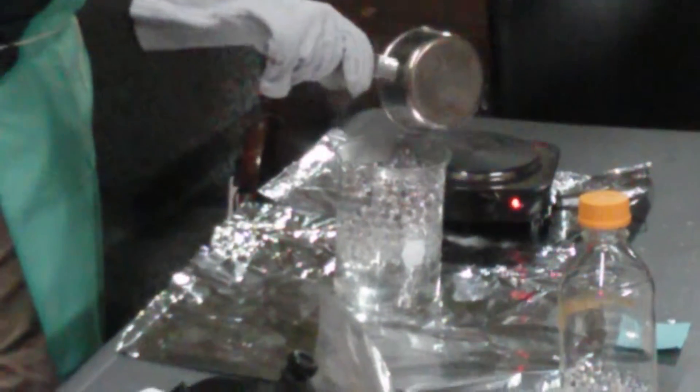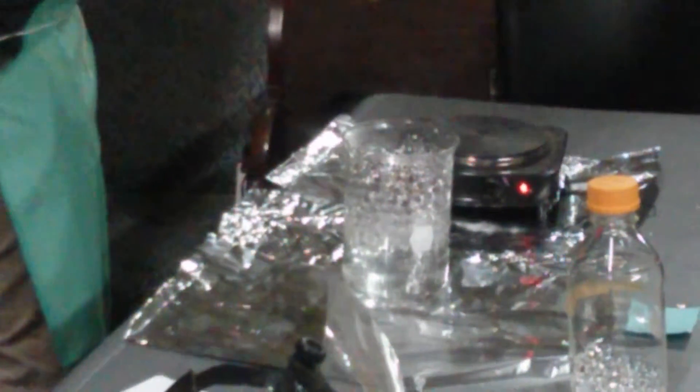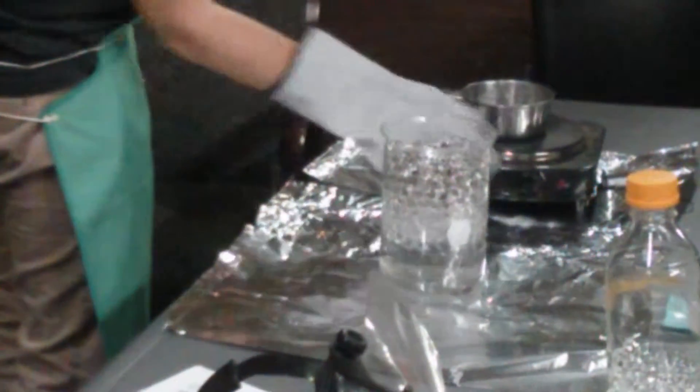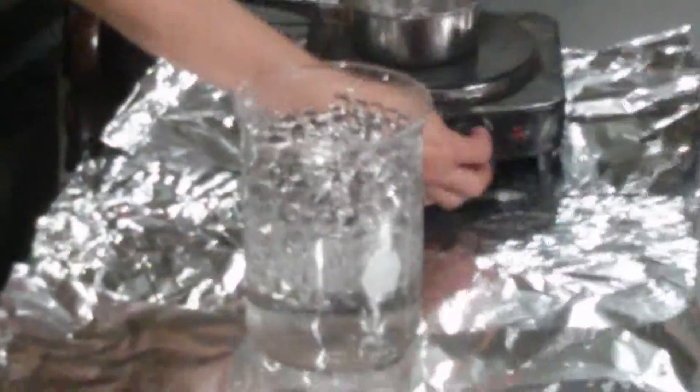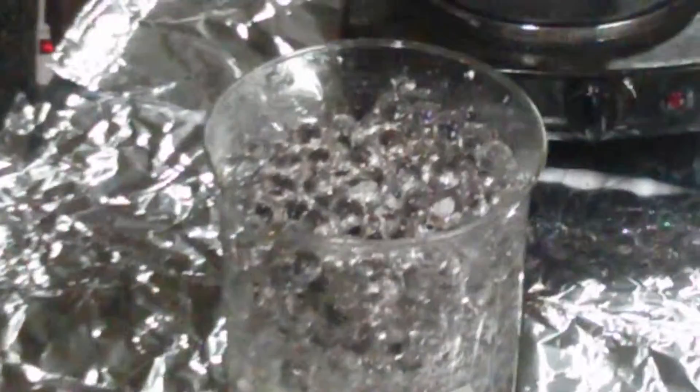Don't pour too close to the glass. Wow, so much. Is it cold yet?